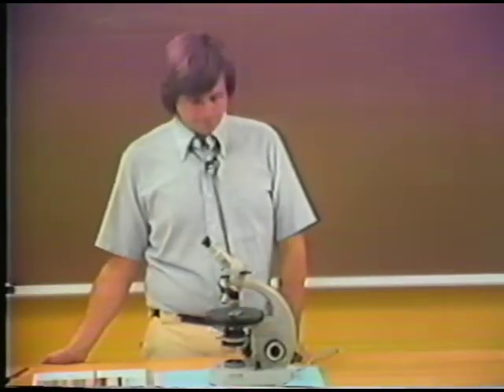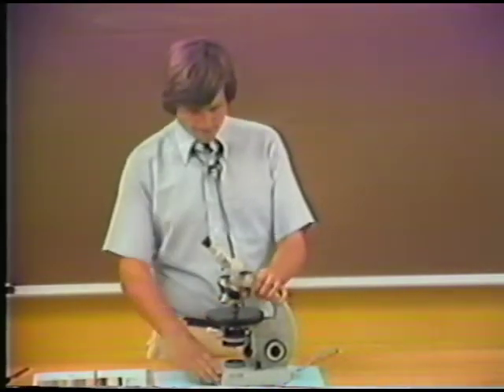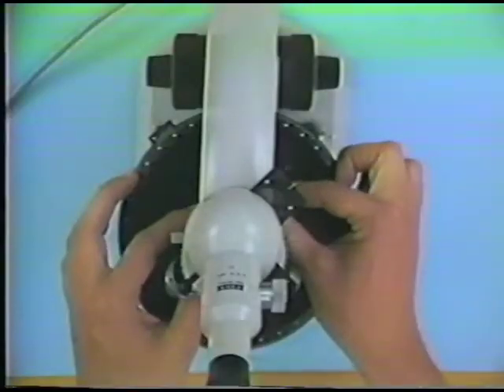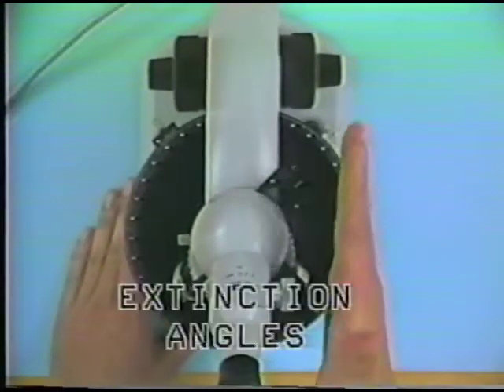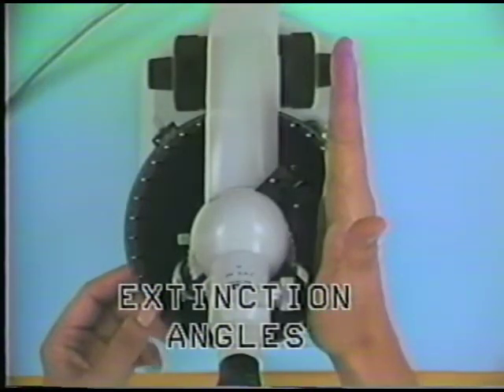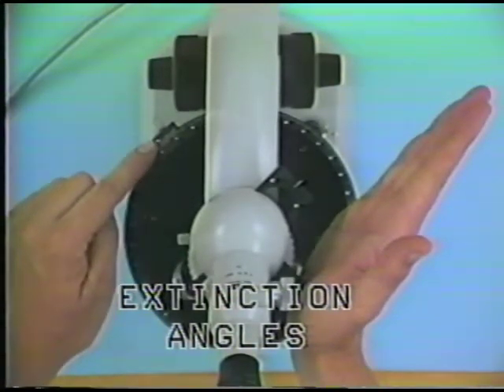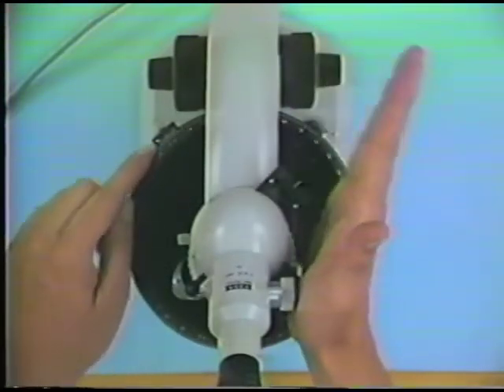Now it's possible, using the microscope setup and the orientation of the stage, to actually measure an extinction angle. For example, if I position the microscope like this and the mineral grain is located in one particular reference position, I can rotate the stage and I can actually measure the angle using the graduations on the stage here between extinction and the elongation of the mineral.